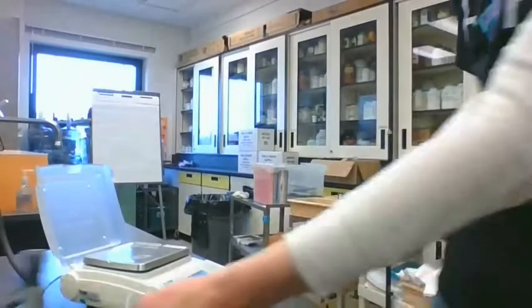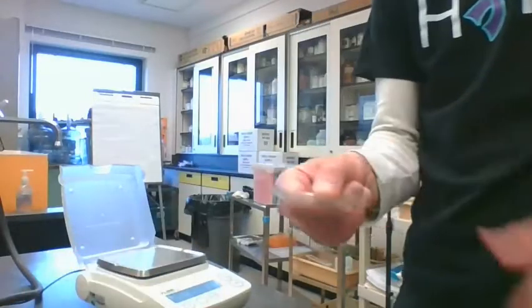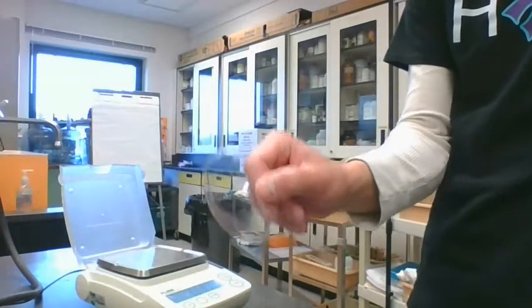We're going to have to again take some mass measurements. So in our data table, we are going to fill in, first thing, it asks you to mass this watch glass, this piece of glass here.